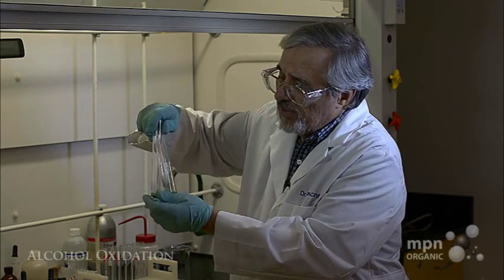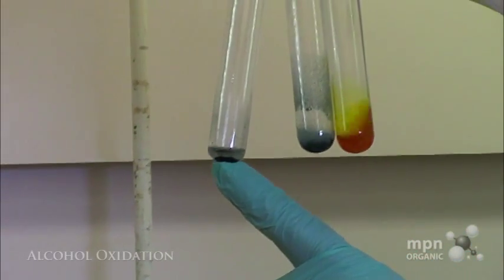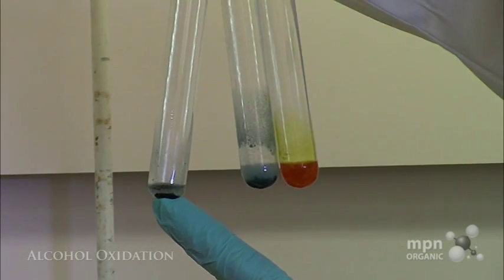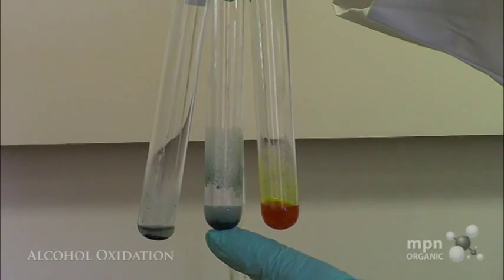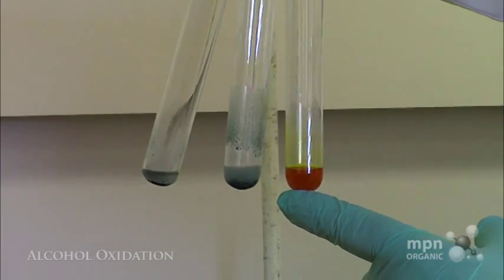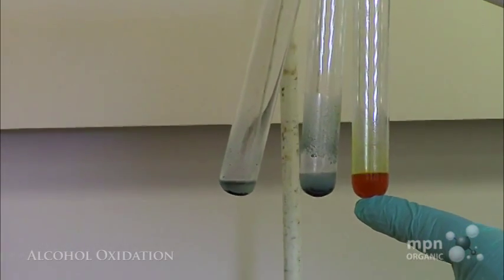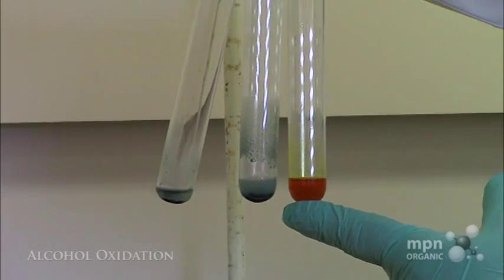You can see, first of all, the results. Here we have the primary alcohol, presumably hexanoic acid in there, and we have the secondary alcohol, presumably 4-methyl-2-pentanone now, and we've got the unreacted 2-methyl-2-butanol tertiary alcohol.